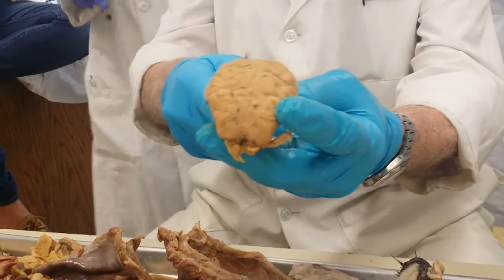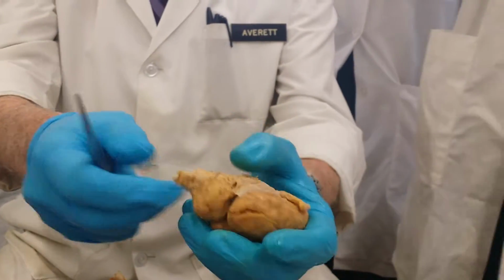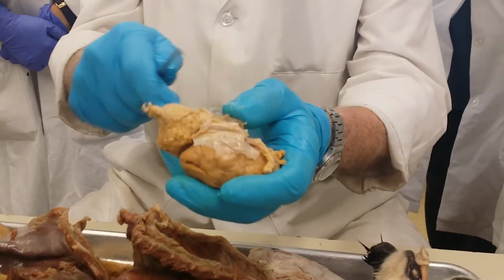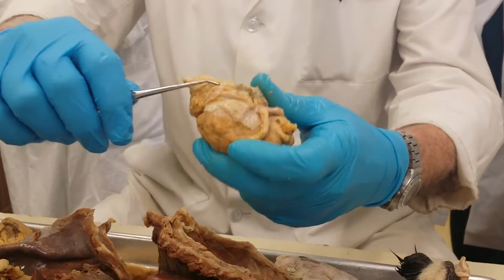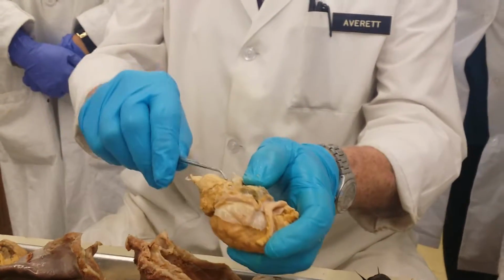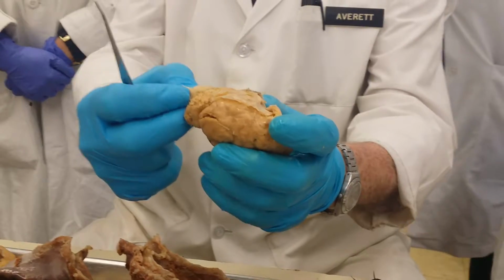Here you have the cerebellum. And the cerebellum, the right side is connected to the left side by way of the pons. There's your pons. See that? This is the dura mater, that thick, heavy piece. But the pons is the tract that you see there. This other part here is medulla, and this piece down here is spinal cord, still attached.